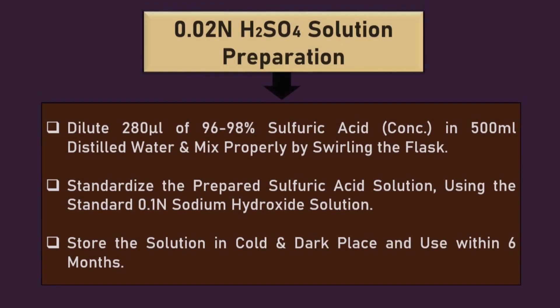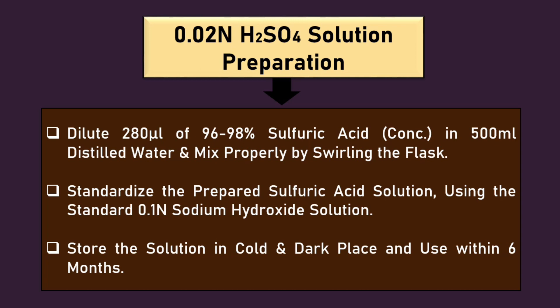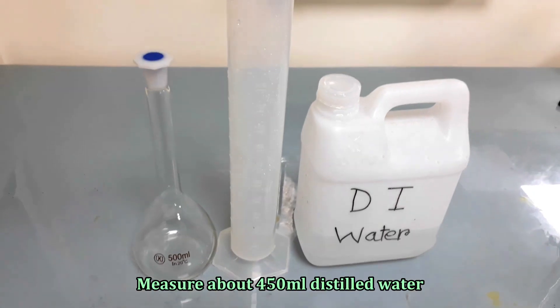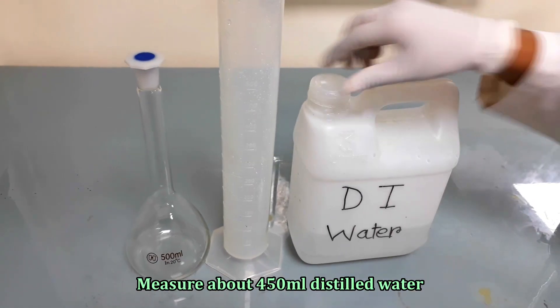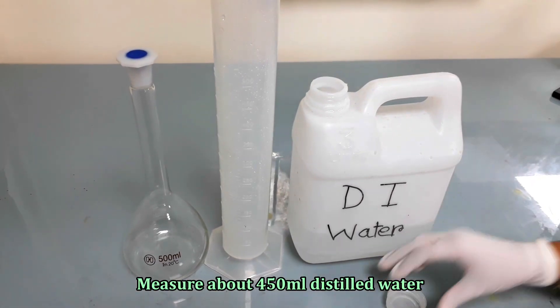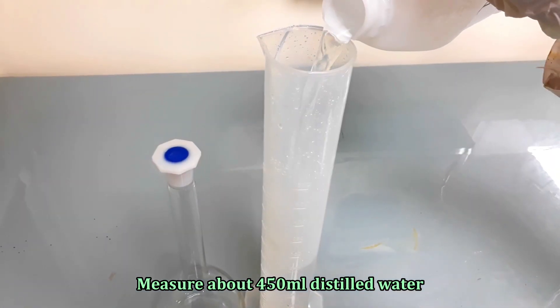First, we will prepare the expected 0.02 normal sulfuric acid solution by diluting 280 microliter concentrated sulfuric acid into 500 ml distilled water. To do this, first measure about 450 ml distilled water and pour it into a volumetric flask of 500 ml.